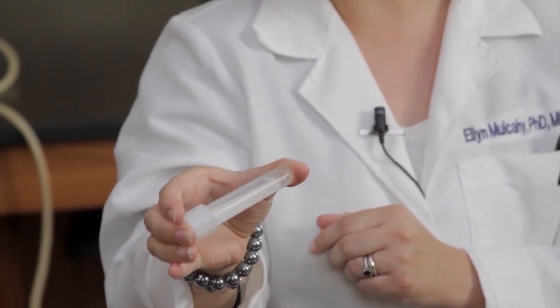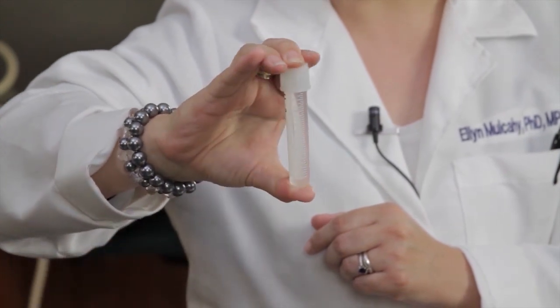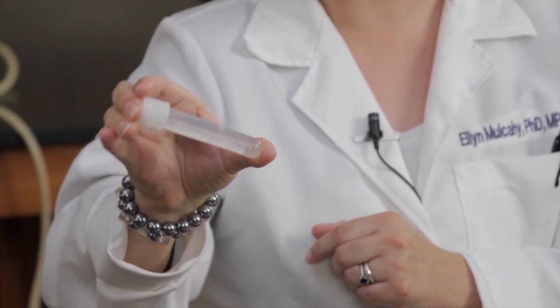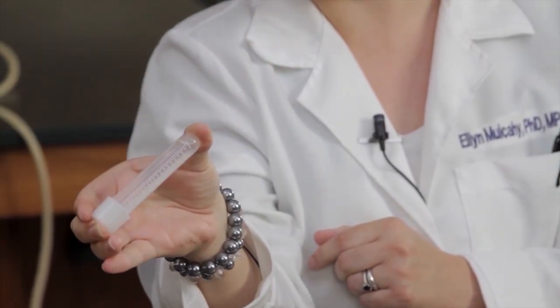And as I'm mixing, the DNA will come out of solution and will form an aggregate. And we'll see that aggregate as white threads in our extraction solution.